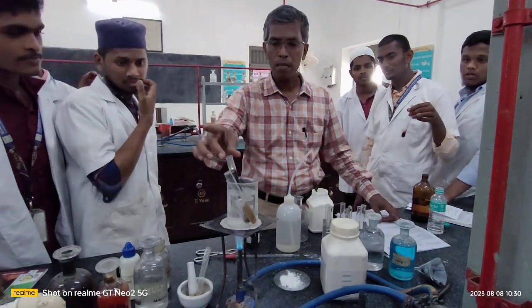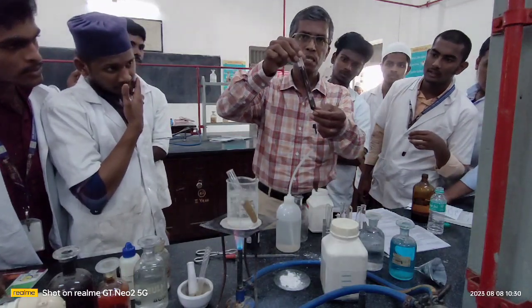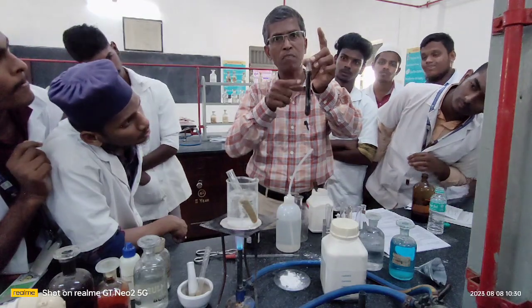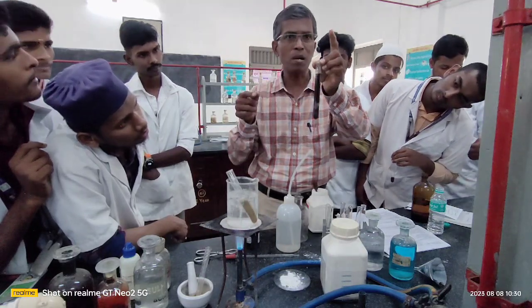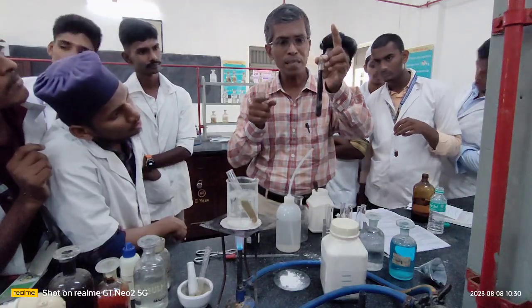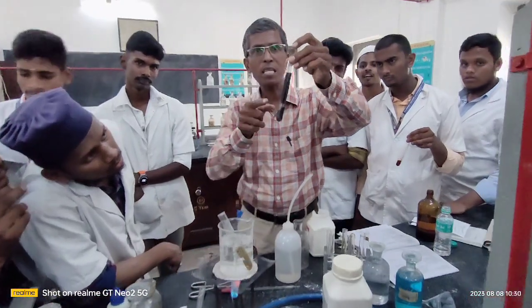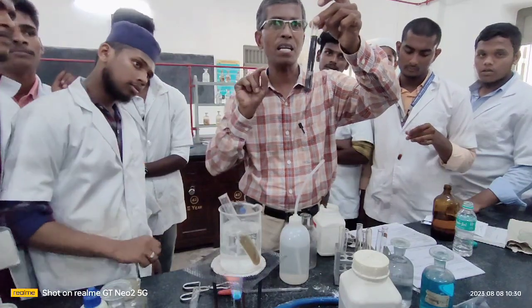Here, see the formation of your silver mirror. After keeping this in the boiling water, you wait for at least 20 minutes. I have taken this out 10 minutes or 8 minutes before. Now the time after being kept inside is just 7 minutes. Due to the lack of time, I have taken this out of your boiling water. Anyway, you can see the silver mirror formation has already started. This is a beautiful silver mirror, and the formation of this silver mirror confirms the functional group carbohydrate in your organic compound.